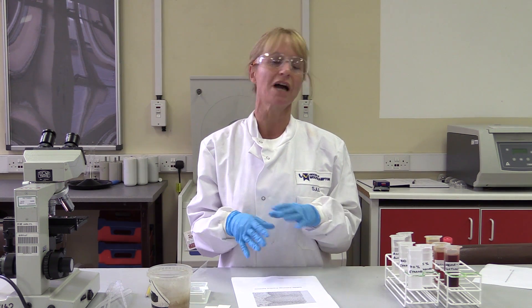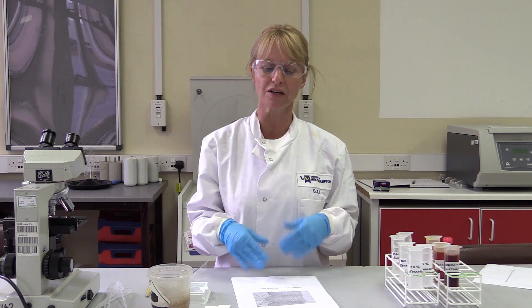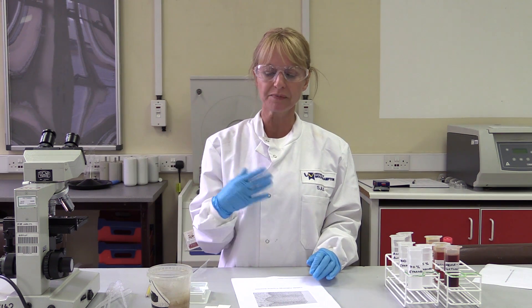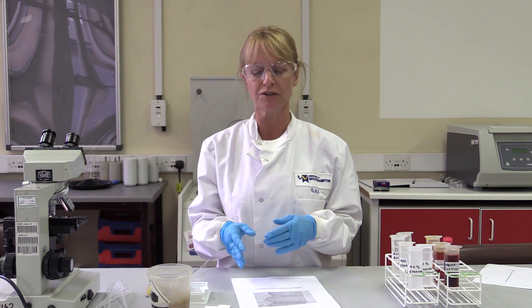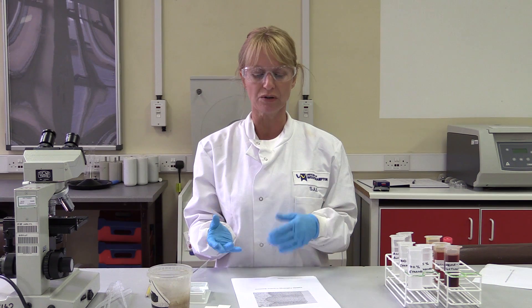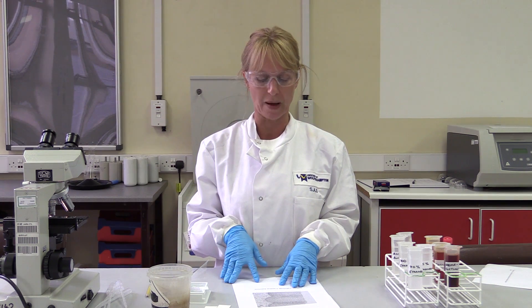I'm going to go through the practical sessions, going through the booklet, and explain how to prepare your slides, how to stain the slides, and what we're looking at when you go through and look down the microscope at them.